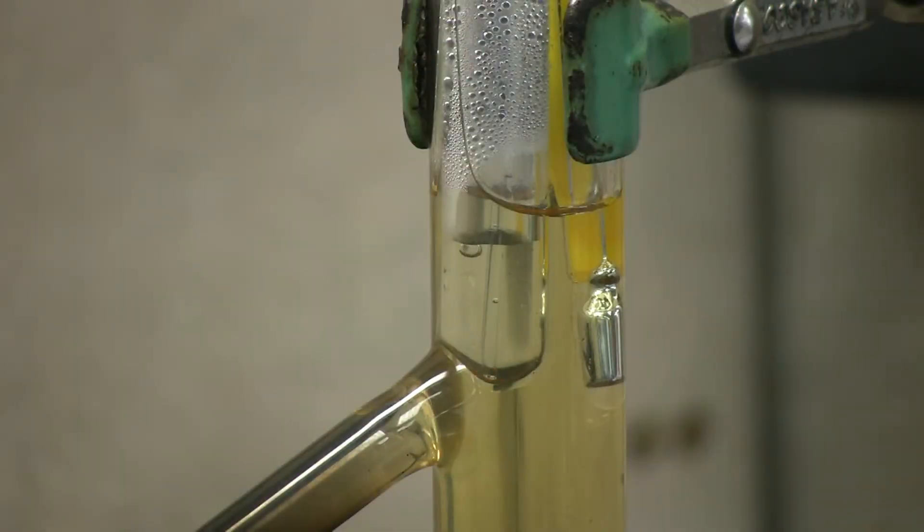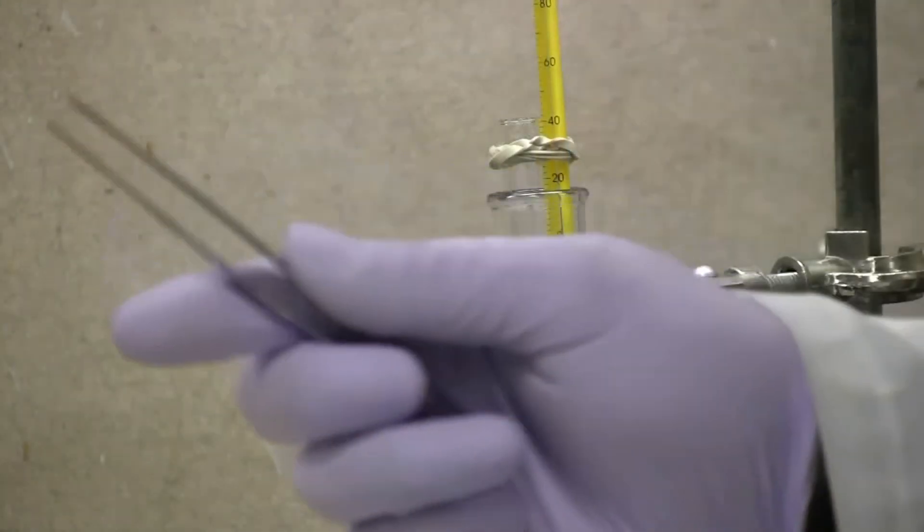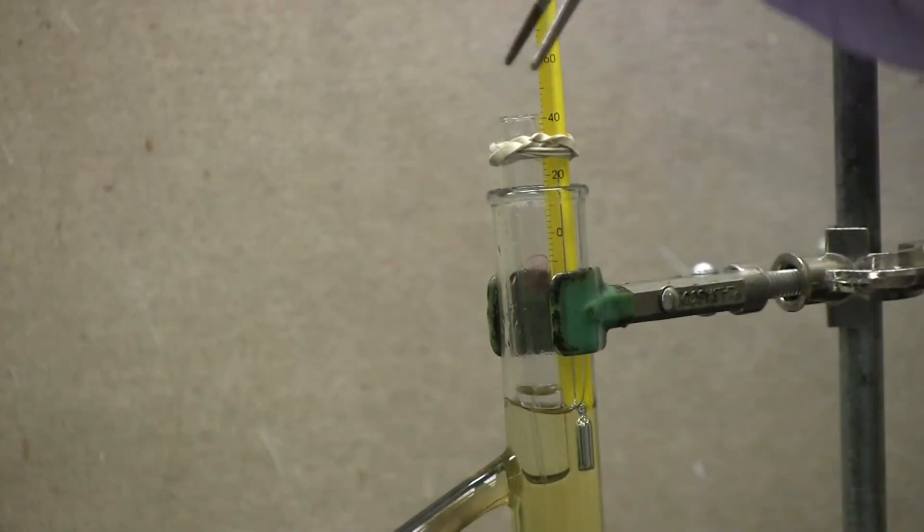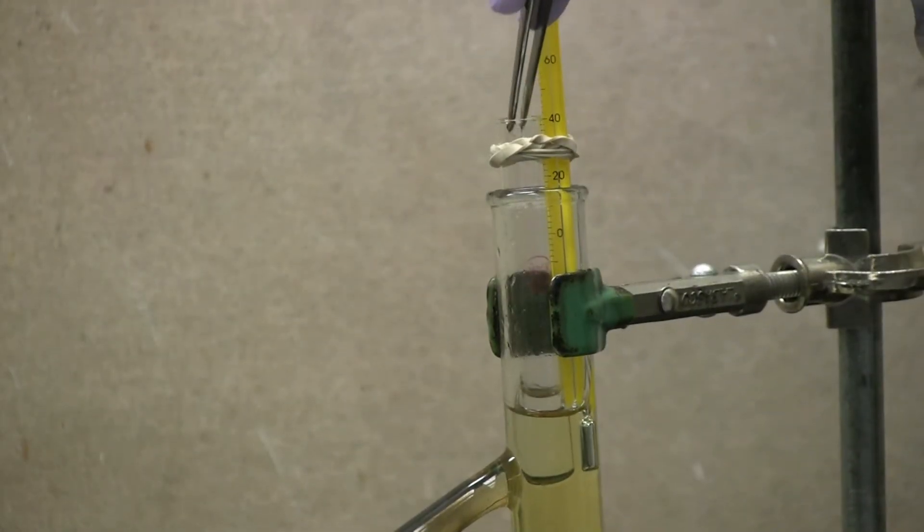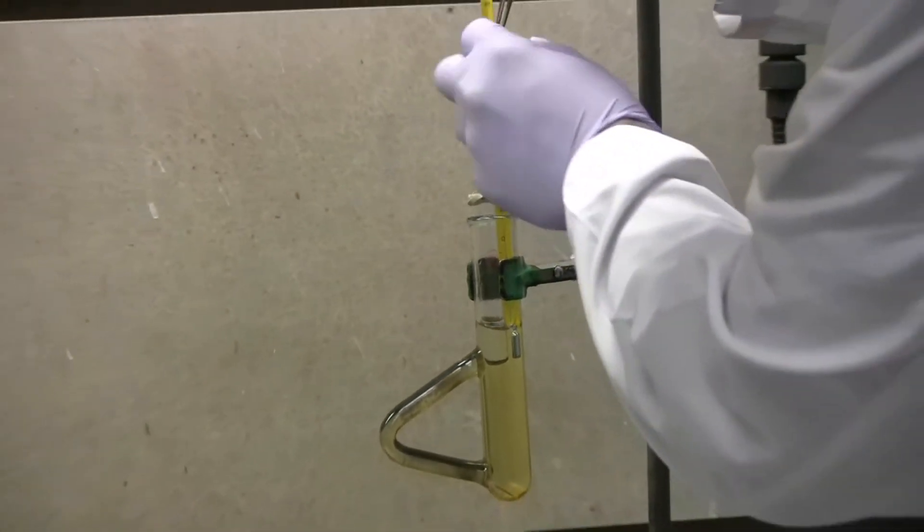Once the oil has cooled, you need to remove the capillary tube with a set of tweezers. Discard this in the waste glass bin.